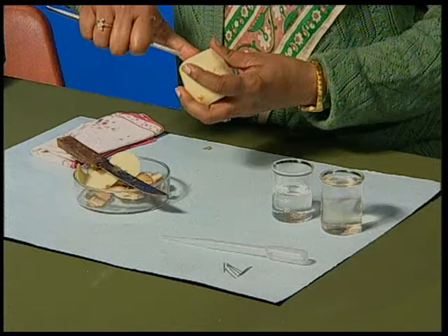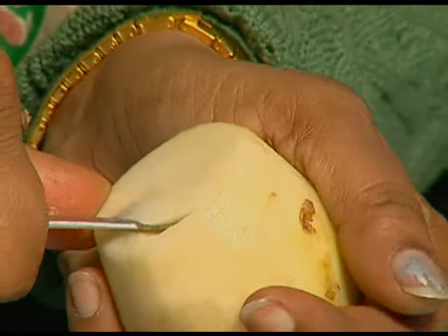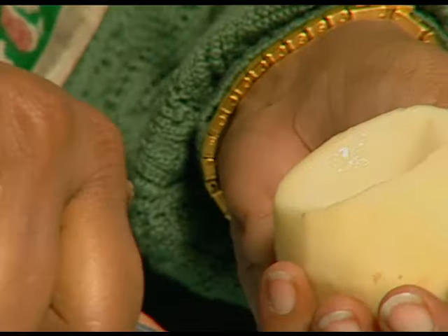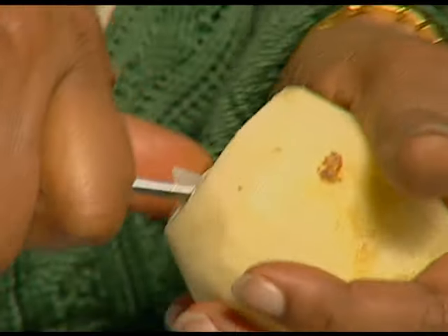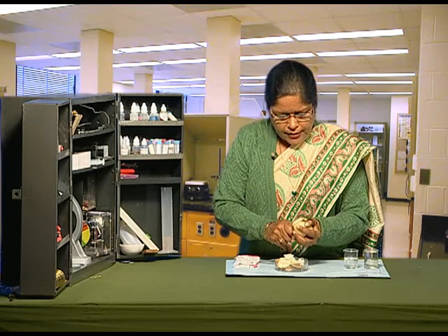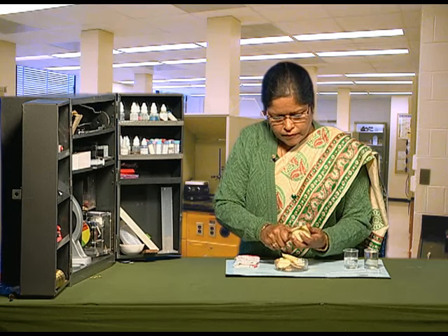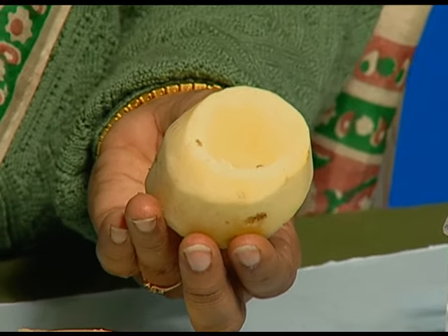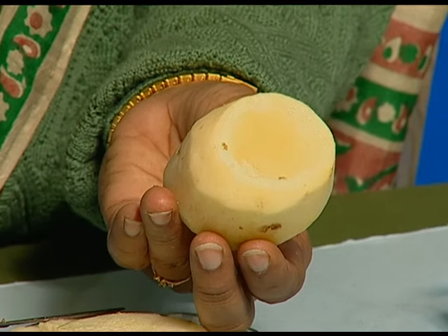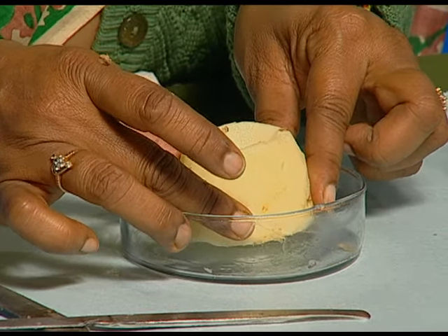And make a cavity in one of the flat surfaces. Since it is big, we can cut the other surface to make it flat. Now this is ready to do the experiment further. We will put this on the petri dish.